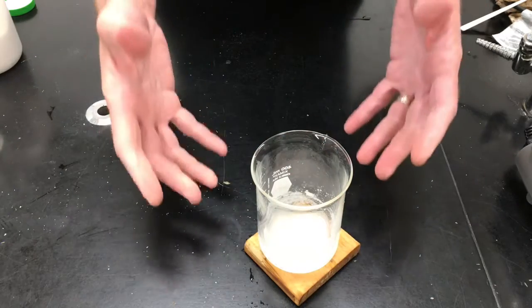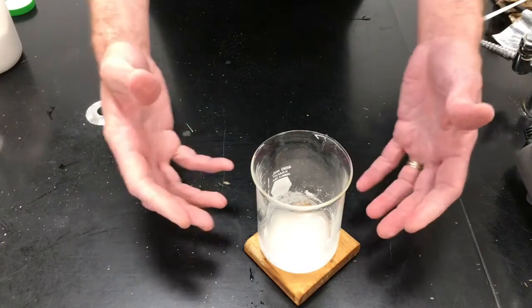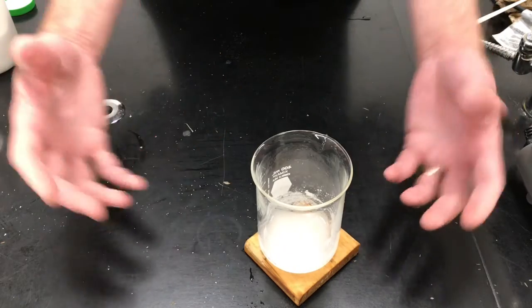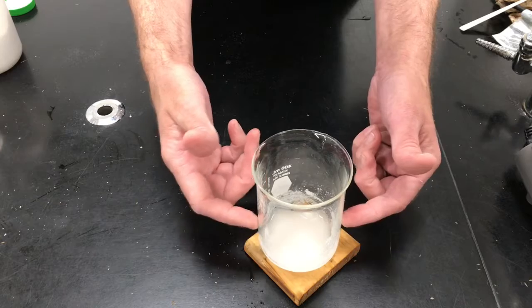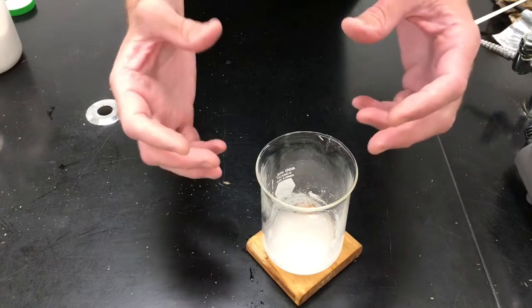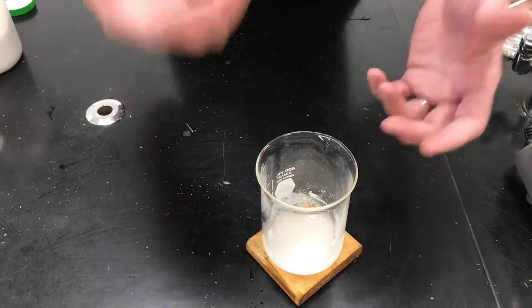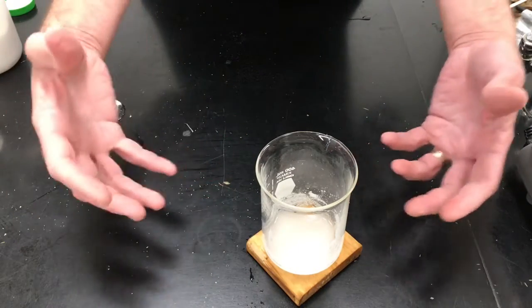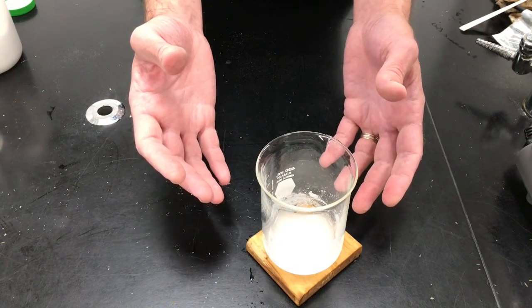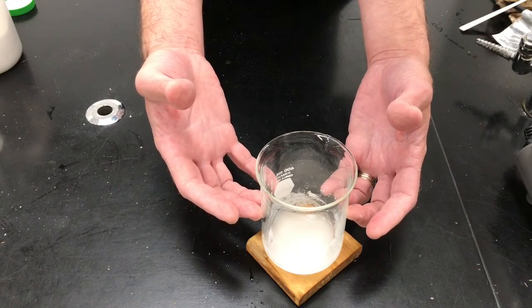What happened is this reaction needed energy for it to happen, so it robbed that energy from the beaker and the water and the wood that was around it. It absorbed that heat, and so that heat went into this process to make everything happen. The two solids interacted. This new liquid was formed. That ammonia gas, again, unfortunately you can't smell, was given off. And that took energy to do, cooling the environment. And this is called an endothermic process, where energy is absorbed by the process or the reaction.